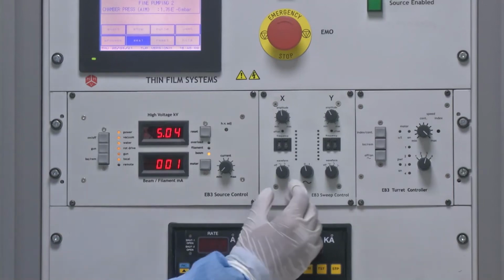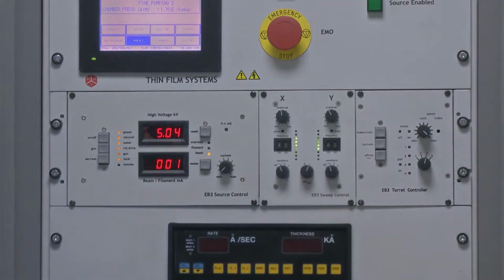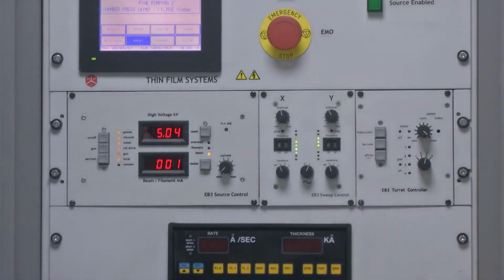Next step now is to turn on the amplitude. Amplitude means the current amplitude. This also defines the shape of the electron beam that is going to be incident on the material supposed to be deposited. It can either be a spot beam, sinusoidal or square beam. These kinds of functions are given in the control panel here. Next step now is to gradually increase the current.